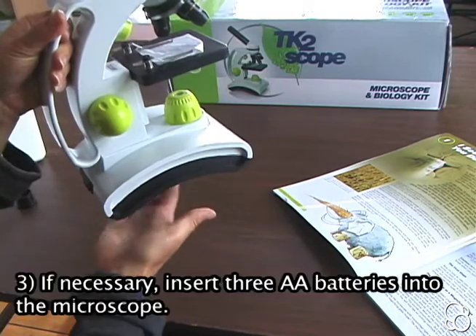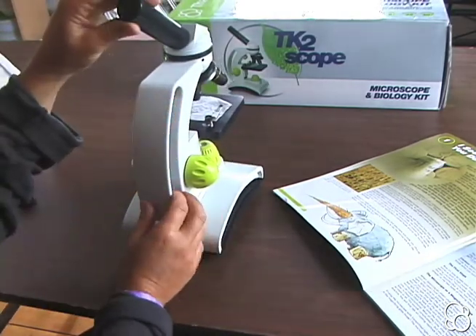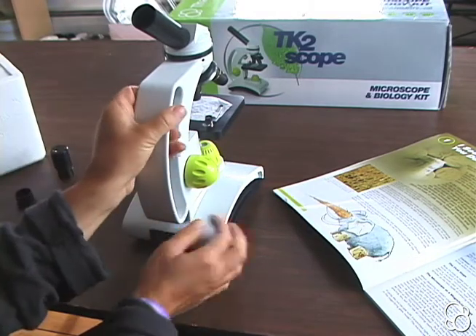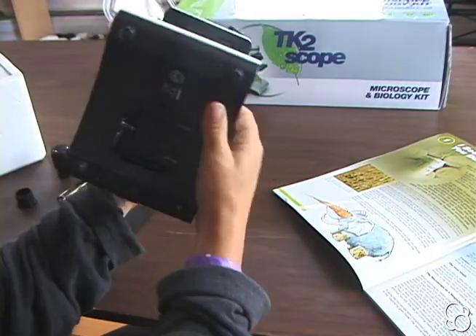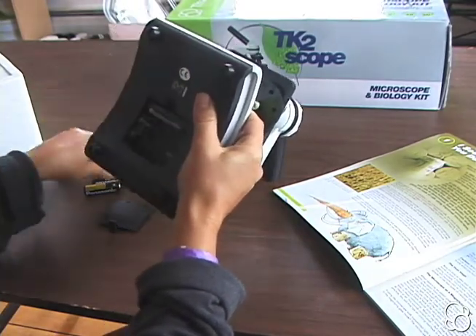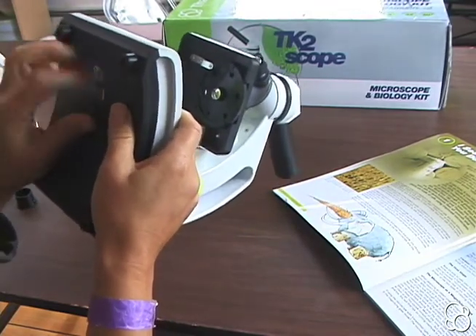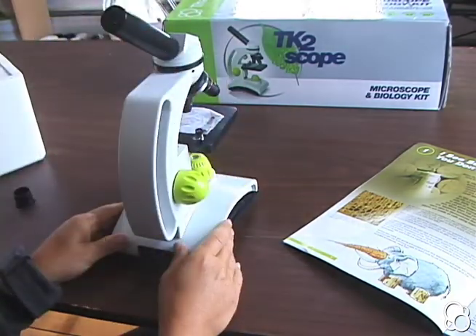If you have never used it, you're going to need to add three AA batteries. If the ocular lens is already in here, you need to take it out. You want to take the ocular lens out, put it down to the side, then you can turn the microscope upside down and open the battery compartment and add the three AA batteries. Then add the cover piece back on, and then fit the ocular lens back on. And now we're ready to roll.